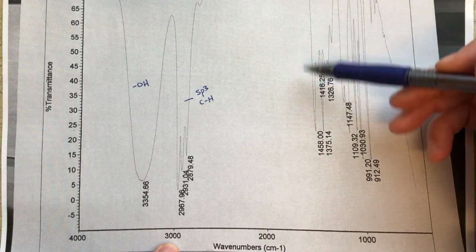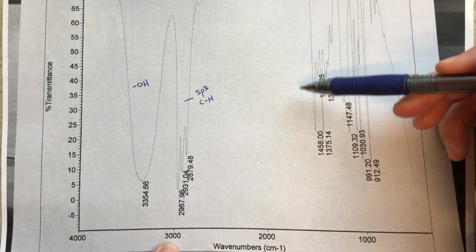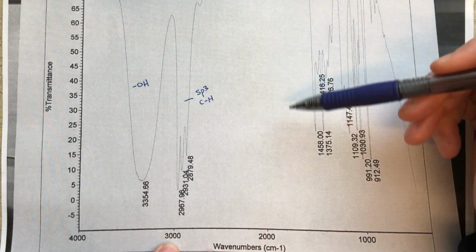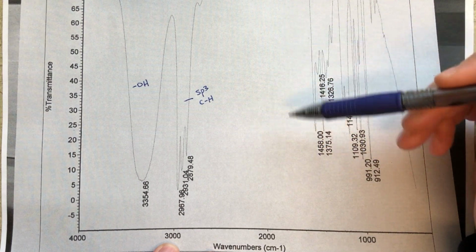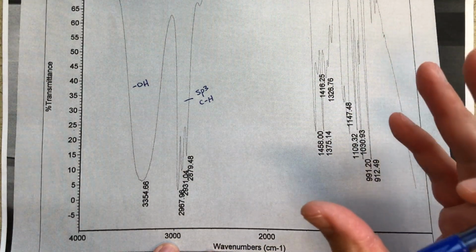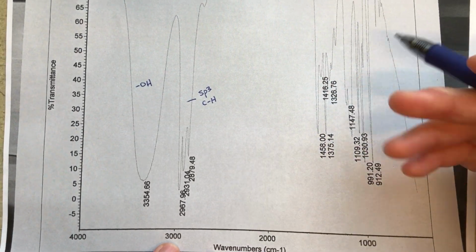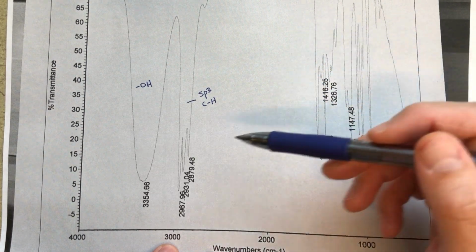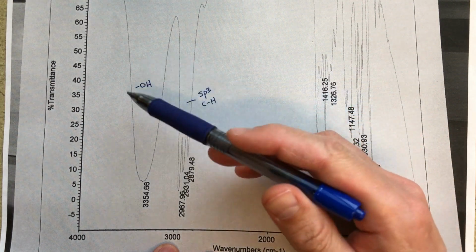And then we also don't need to worry about anything in the carbonyl region. So 1680 to 1715, something like that, or 1700-ish, sort of a more narrow but also very strongly absorbing peak. That's where our carbonyl carbons would come. C double bond O stretch, that's where that would be. So we do not have that in this IR, but those are like the most common things you're going to look for in IR: where's that C double bond O? How is it shifting? Is there conjugation? Whatever. But we definitely do not have that. This tells us we've only got sp3 hybridized carbon and hydrogen bonds, and then clearly an alcohol.